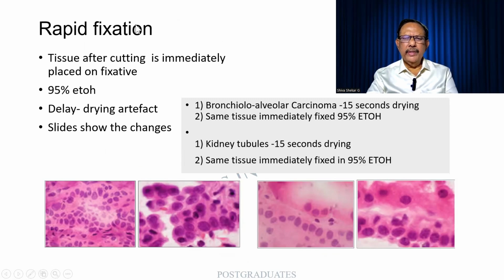A rapid fixation. This indeed is required. After all, the process is supposed to be rapid. So it is placed in 95% ethanol, and the delay will cause an artifact. And the slide will show changes. Look at this. This is a case of a bronchoalveolar carcinoma. There has been a drying artifact over here, whereas this appears quite normal. Similarly, the kidney tubule. You find this section is quite poor, whereas here, after fixation, you find that the details are well brought out.